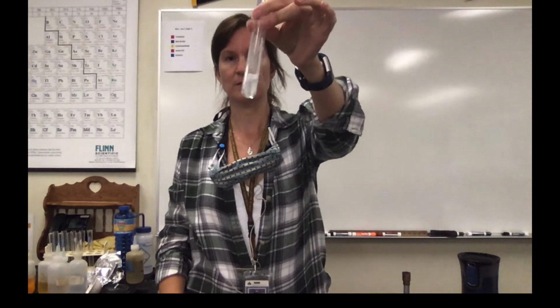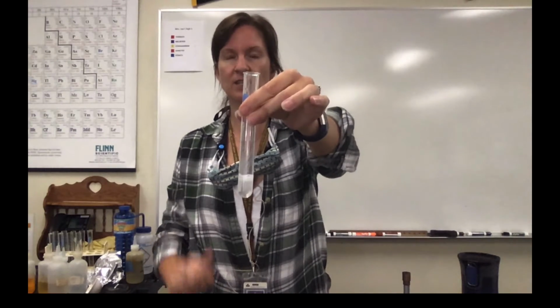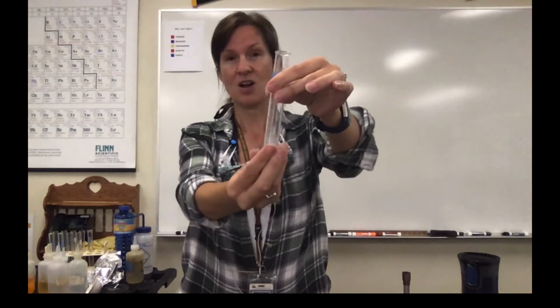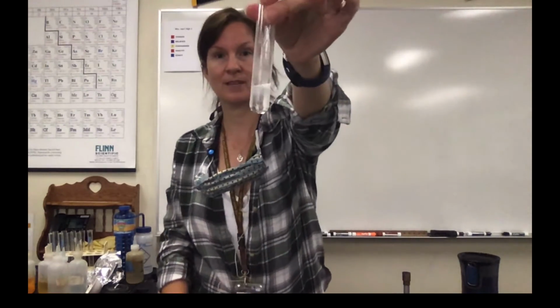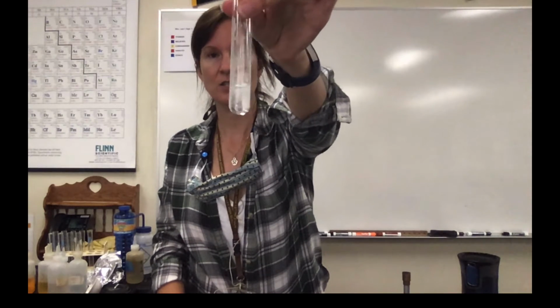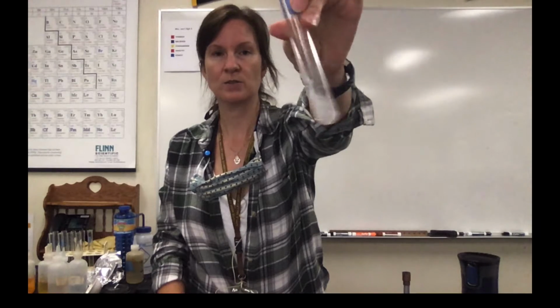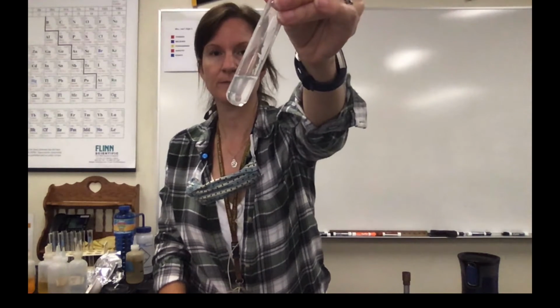You can obviously make observations during. One thing I will tell you in case you can't see it is there does seem to be smoke coming off or some kind of outgassing. Also, if you felt this, it gets a lot warmer than it was before. Okay, so observations during. And then you can also look at your material afterward. So that's what it looks like.